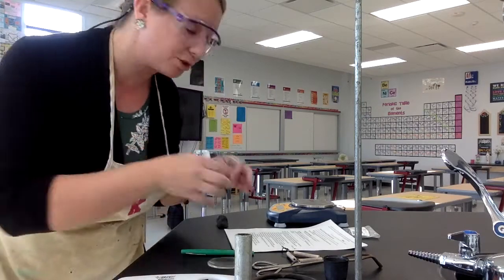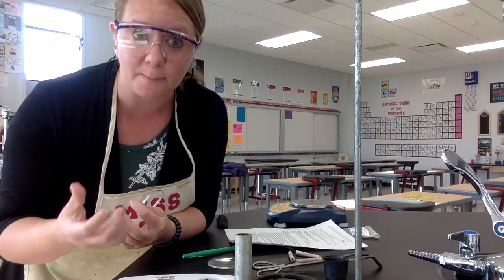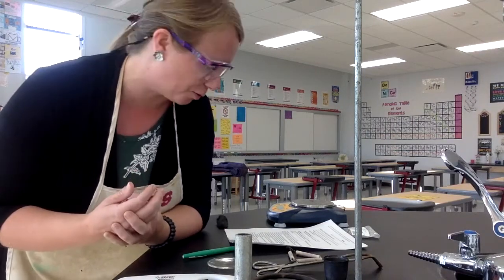All right, welcome back. So assuming you've done your hypothesis, you now have a prediction of what that compound should be, and then we're going to take experimental data, test that hypothesis, which is a very normal thing in the experimental or scientific world. Okay, so you can see the procedure is spelled out for you. The list of materials is there.